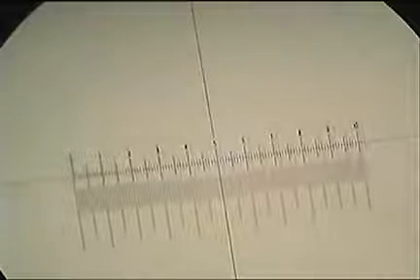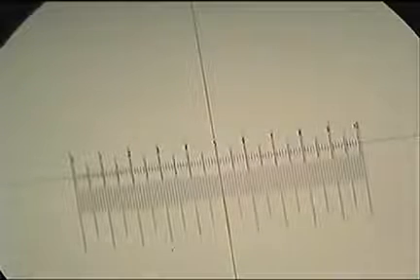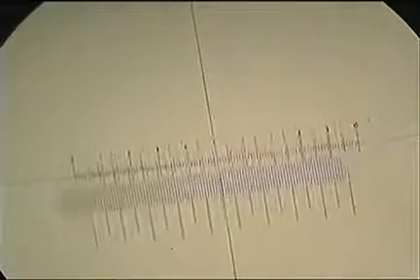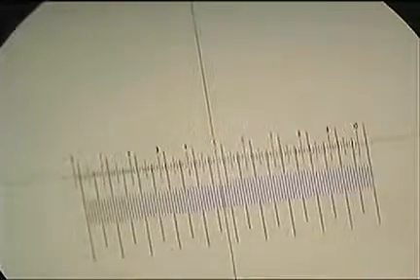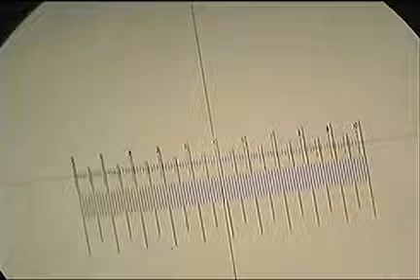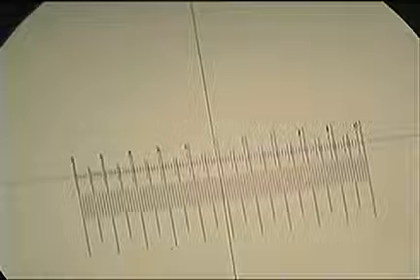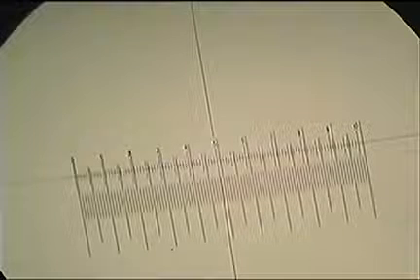So here's me trying to line up the two scales. The stage micrometer I said was labeled 0.01 millimeters. That's the distance between the smallest units on there, the short lines, which are a little bit fuzzy. Between the largest lines on the stage micrometer, there are 10 of the smallest units, so that's 0.1 millimeters. And the entire stage micrometer, which is 10 of those larger ones, is 1 millimeter. So looking at where it lines up, I'm looking for two lines that line up.